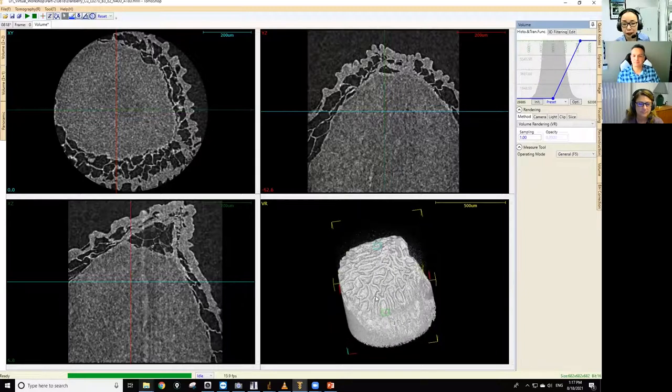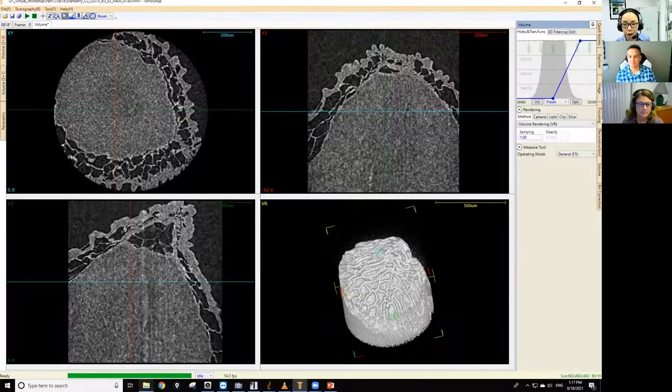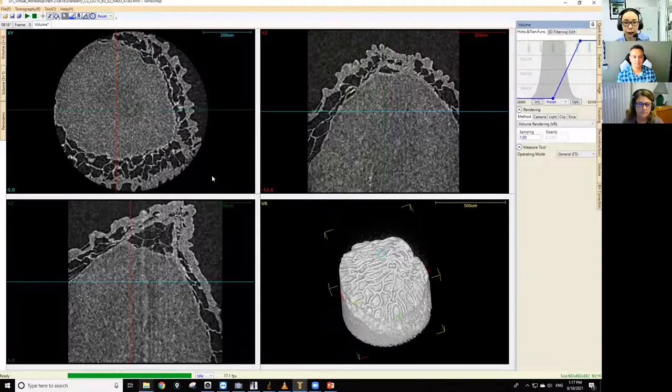So this is the tip of the seed. You can actually see quite a bit of wrinkled surface details. And you also see the center part of the seed and the skin, and in between you have this kind of intricate structure, which you can see pretty well in this scan. Now, we did this with binning 3x3, 400 projections.